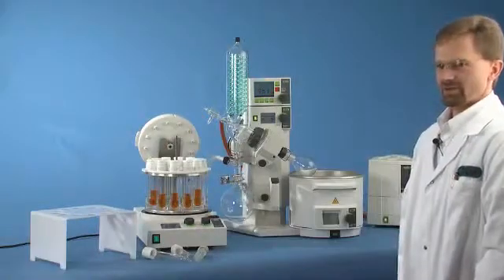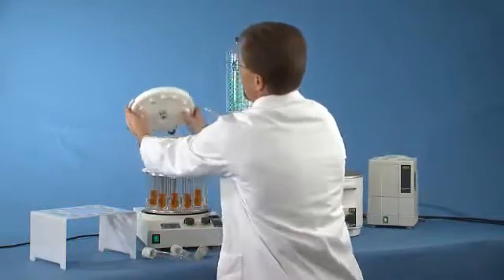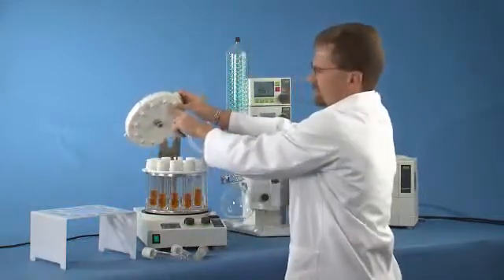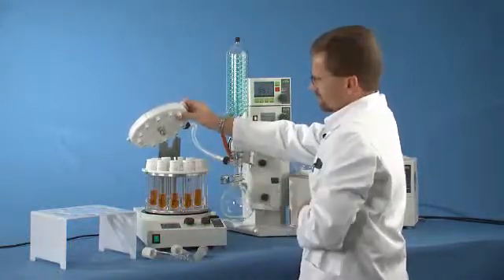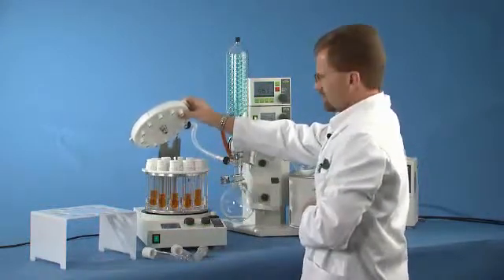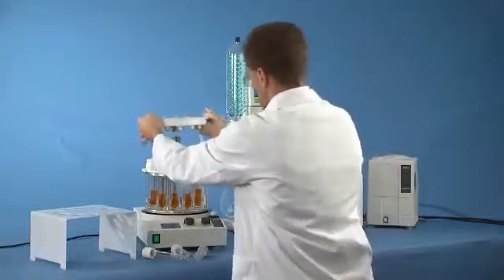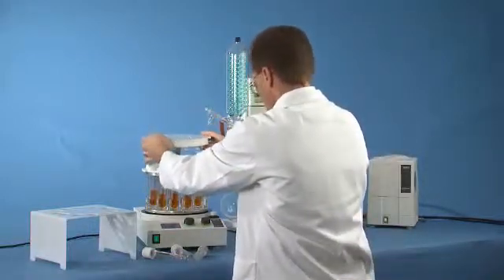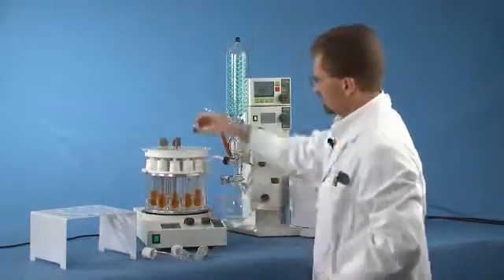The next step is to put the lid onto the vessels. So you simply lift the lid from the holder, and you can see that we have individual seals for each vessel. Therefore, enabling a tight seal for your vacuum control as well as eliminating any chance of cross-contamination. Simply place the lid on top, tighten it down.